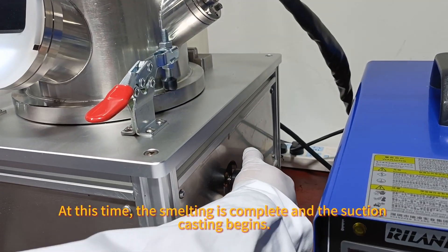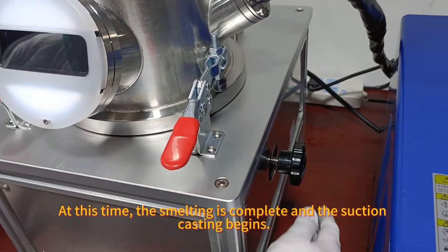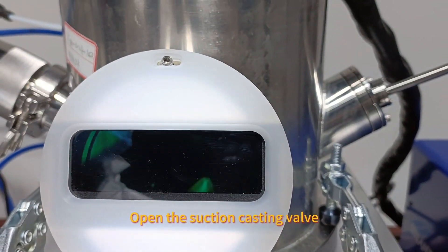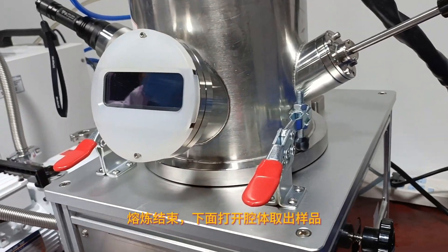At this time, the smelting is complete and the suction casting begins. Open the suction casting valve.